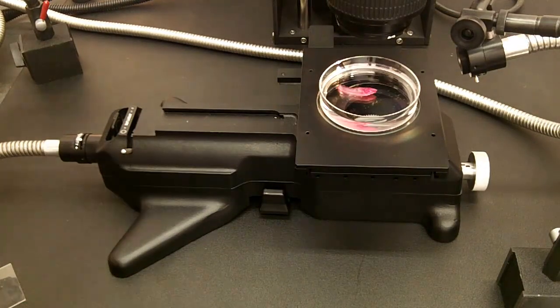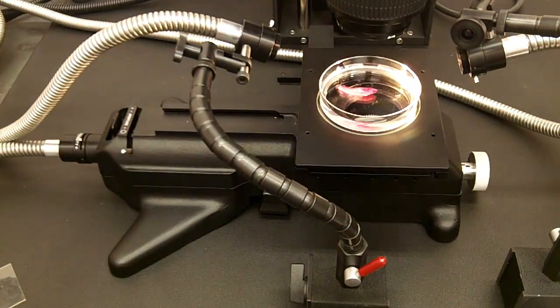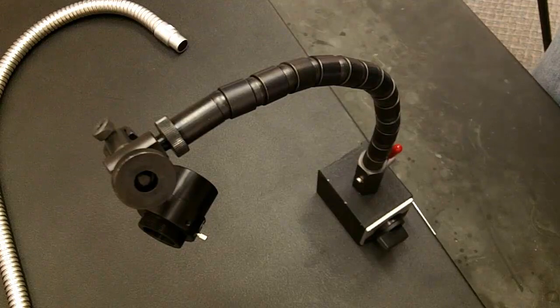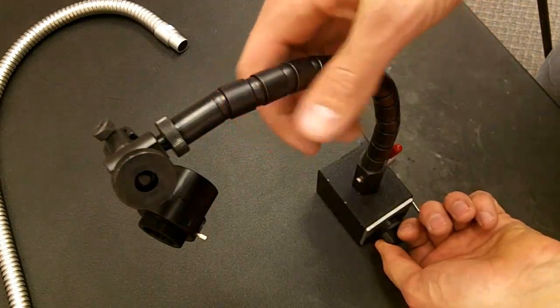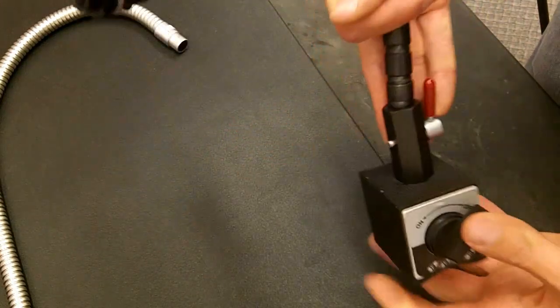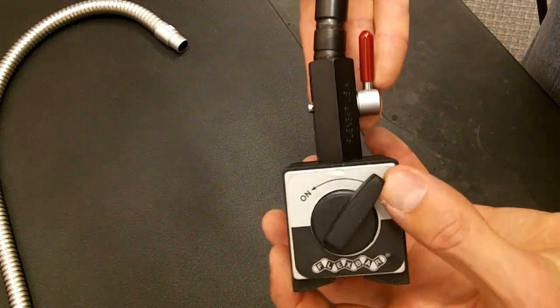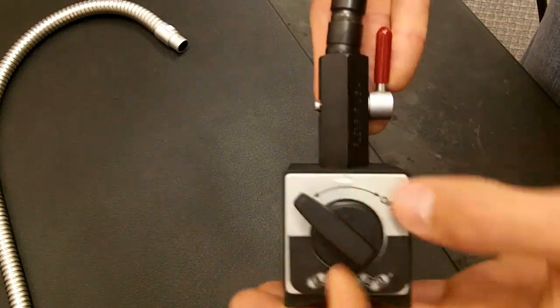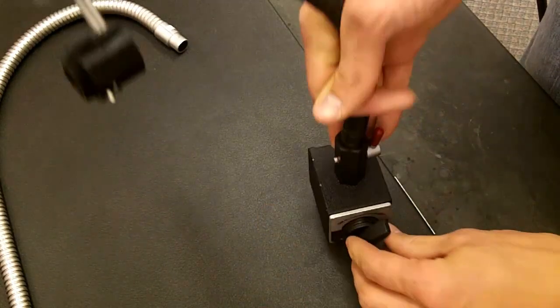Now I'm going to go into how to use and set up the fiber optic arms. This first knob is the knob that turns the magnetic base of the fiber optic arm on and off and allows it to be attached to the Visionary Digital platform.